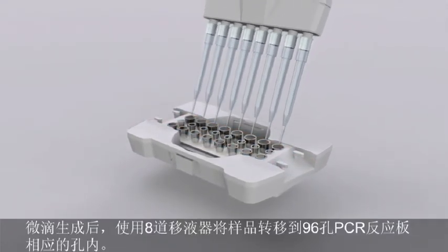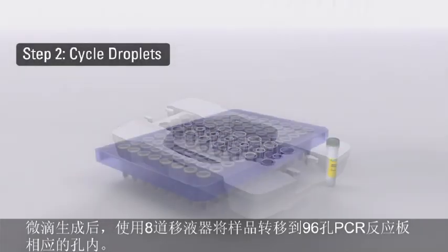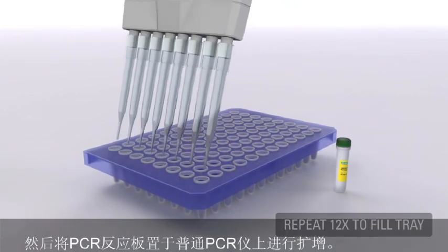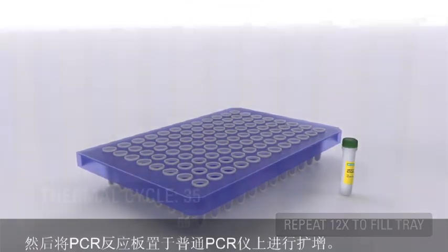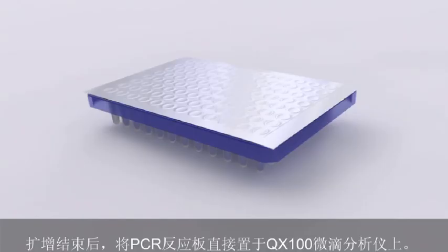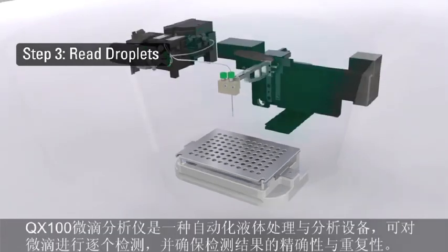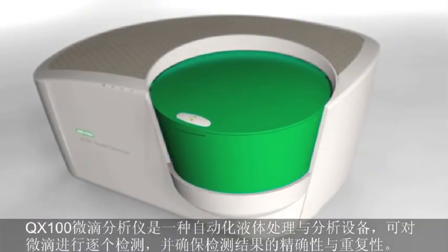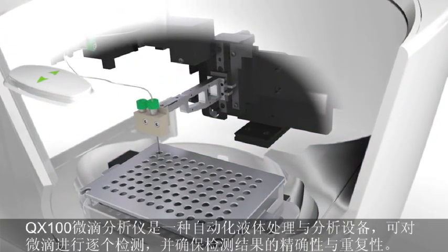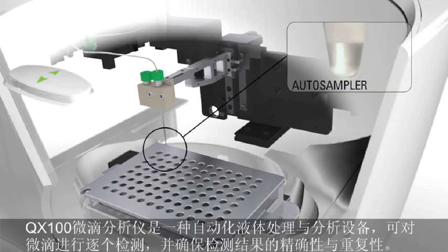After the droplets are generated, the emulsified samples are transferred to a standard 96-well PCR plate using a standard 8-channel pipette. The plate is then loaded onto a thermal cycler where PCR is performed to amplify the target DNA to endpoint. When PCR is complete, the plate is loaded onto the QX100 droplet reader. The QX100 droplet reader is an automated liquid handling device equipped with optimized microfluidics designed for precise, reproducible detection of target DNA sequences, droplet by droplet.